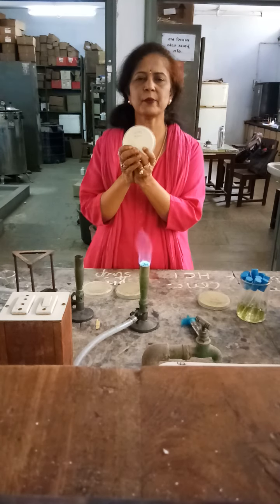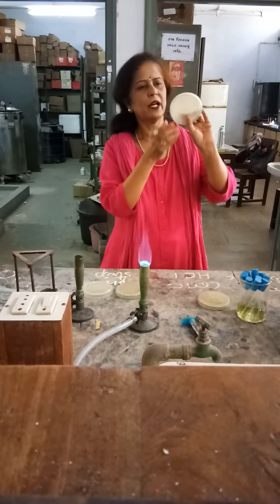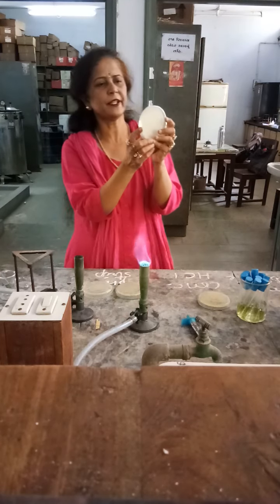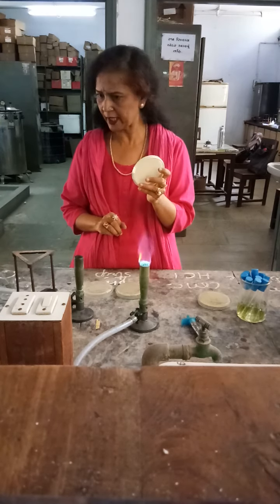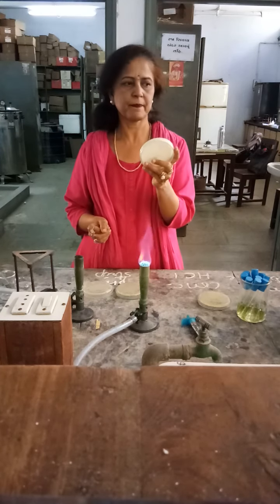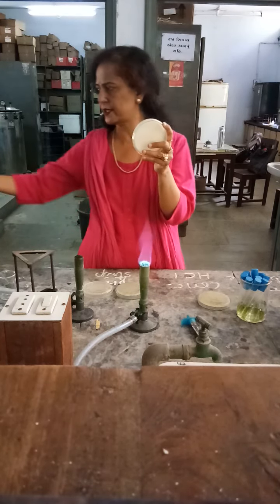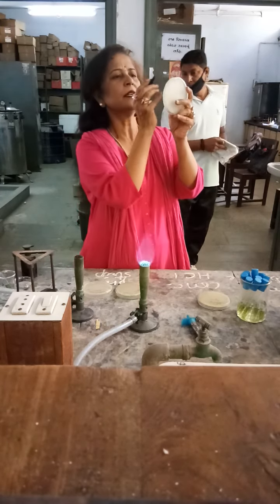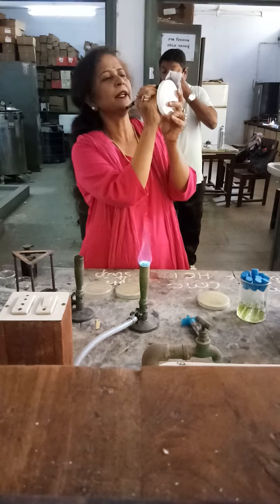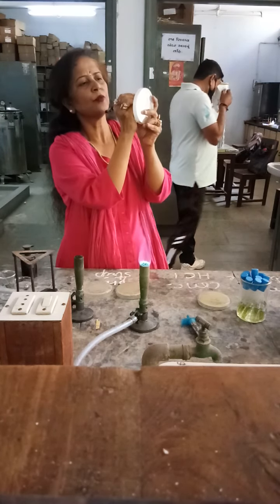In the case of a calcium carbonate agar plate, you have to observe the dissolved calcium carbonate. It will give you a clear zone around the colony, so you can mark those colonies. Organic acid will dissolve calcium carbonate, and you can see a circular clear zone around the colony of organic acid-producing bacteria.